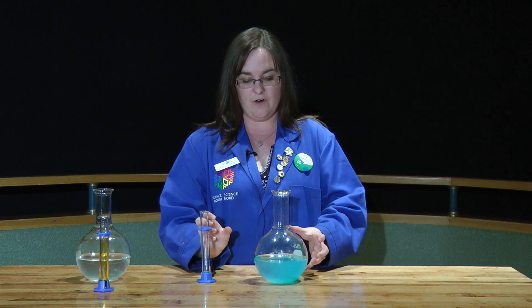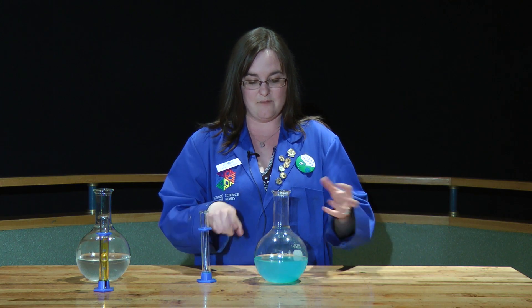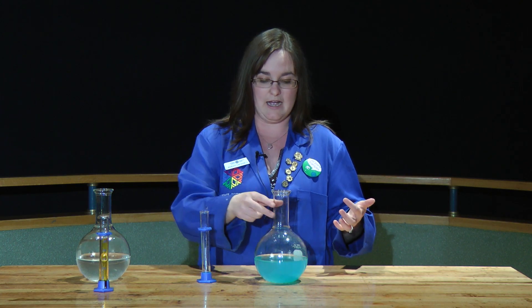So you can see from far away, it probably just looks like a little bit of food colouring in there, or dye. But if you get up close, you can see that there's actually little tiny solid particles in this solution. Now, scientists use this in order to create, but also isolate, certain chemical products that they want.